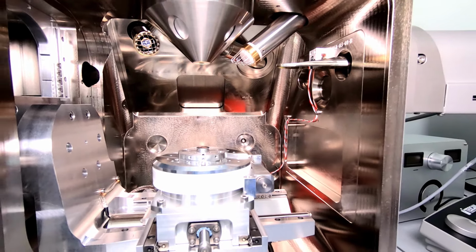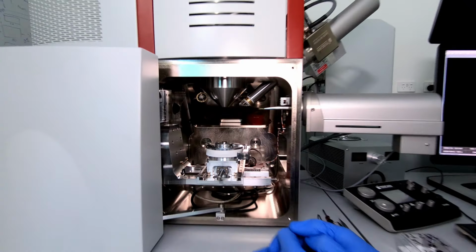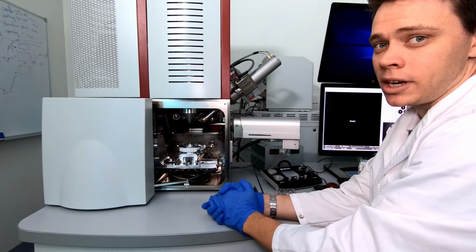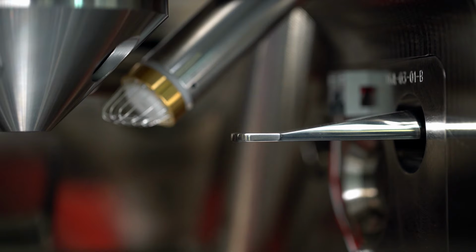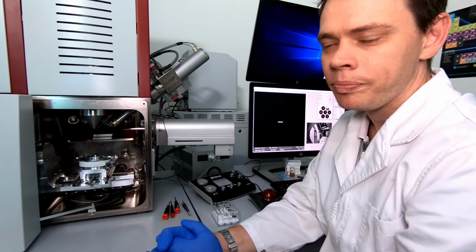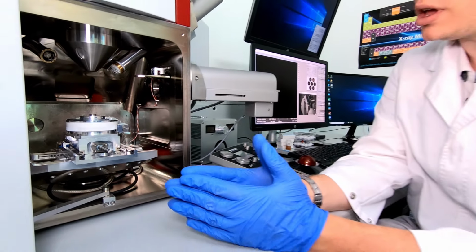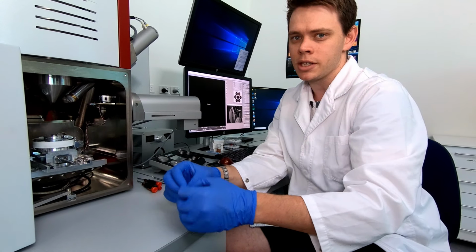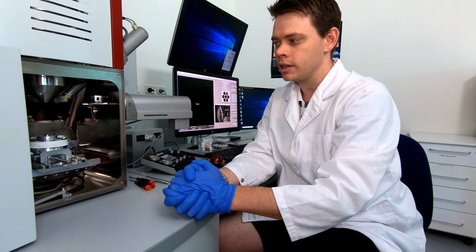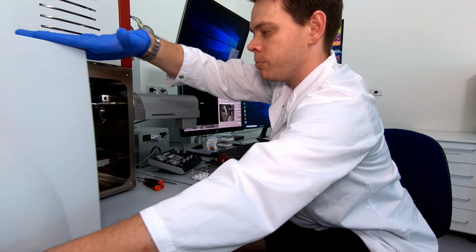While the stage is homing, let's have a look at some of the detectors we have on this microscope. We have the secondary electron detector up in the back corner over here. And this generates the normal SEM images that you would normally see published everywhere on the internet. Just a typical SEM image. This one here is a backscatter detector, which is good for determining elemental contrast in your sample. And this one here is the variable pressure detector, or the VP detector, low vacuum detector, and it's good for charging samples, where you can introduce a small amount of gas into the chamber, and it will countercharge your sample. So let's close the chamber and pump it down.